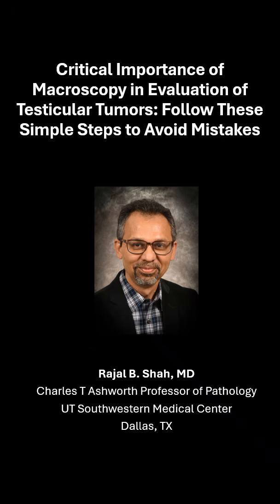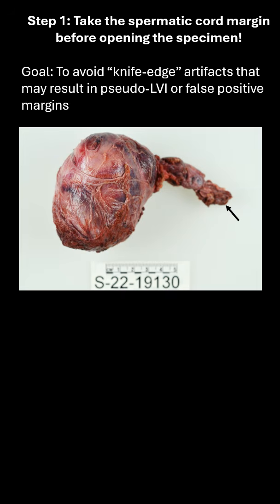I can't emphasize enough the critical importance of macroscopy in the evaluation of testicular tumors. Follow these three simple steps to avoid mistakes. First, always take your spermatic cord margin before you open the specimen.